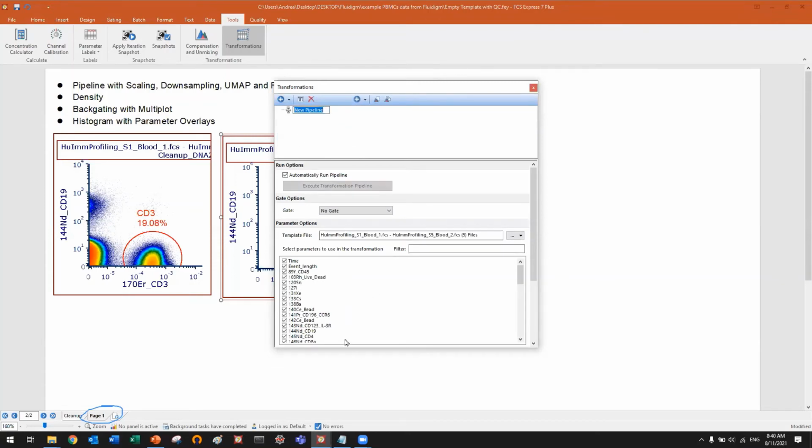And this is the main pipeline body. You can change the name. You can set here the gate of interest. You see I'm selecting my CD3 gate. And here you have all the parameters selected. So I want to use every parameter as the initial input for my pipeline. My suggestion is do that, because at every step later on, you will be able to select a subset of parameters. So in this main pipeline body, just select all. And indeed, we are automatically selecting all. But otherwise, you can also right click and select all manually.